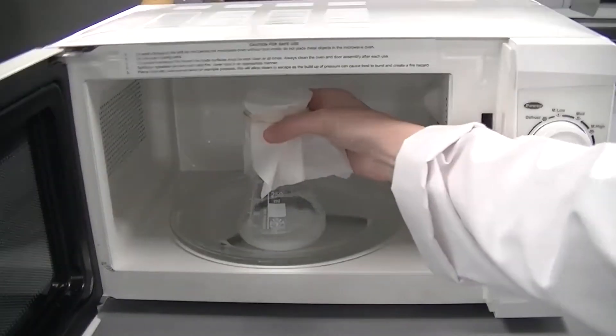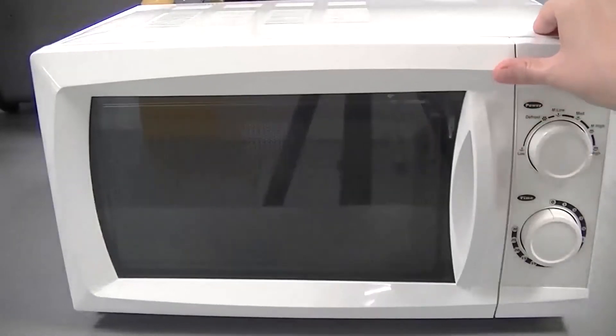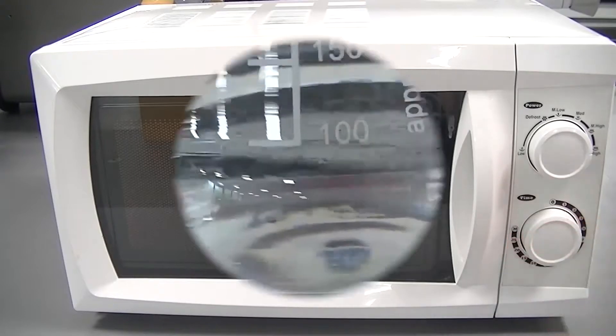Place in the microwave and heat on full power for 1 minute and then for 20 second intervals until dissolved. The liquid will be completely clear when ready.